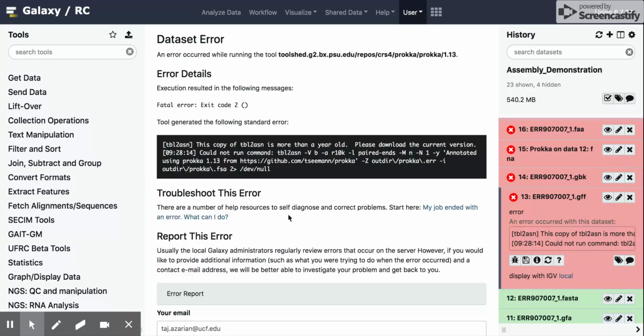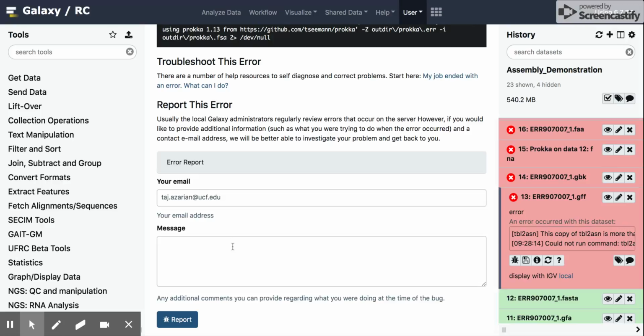If you really thought this was an error on the side of Galaxy that the RC help could address, then you could go down here and type a message, like, please update blah, blah, blah, which I've already done, and report it. They will assess the error and determine whether it was a user mistake or whether it needs to be updated in the system. Then you would just click the report button and that would get sent.